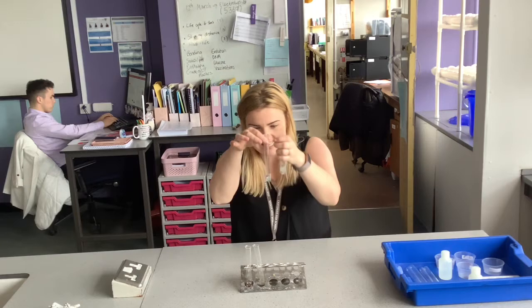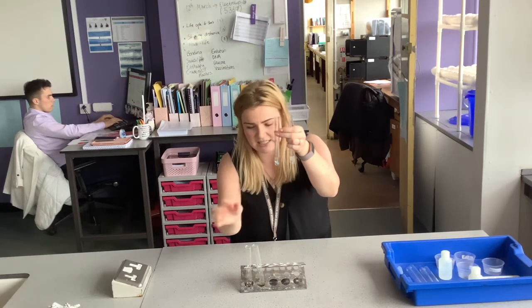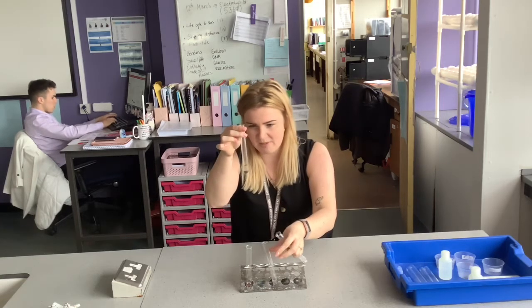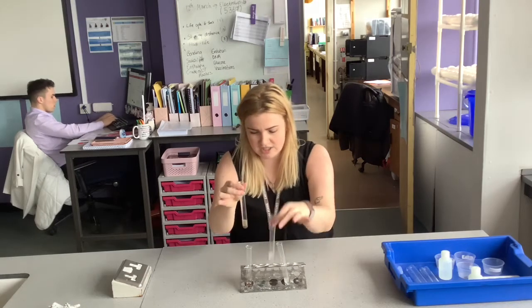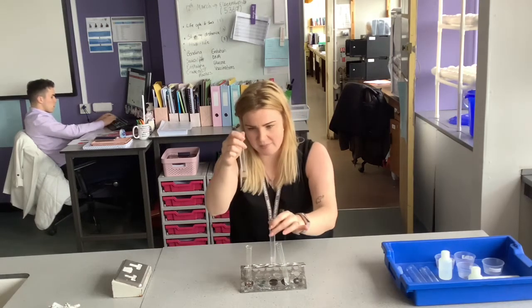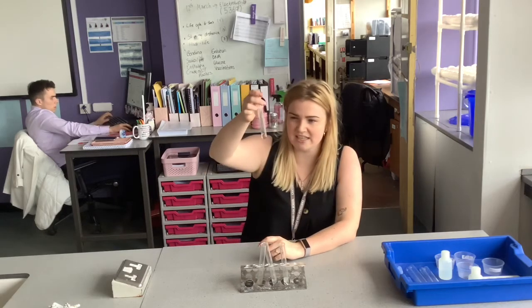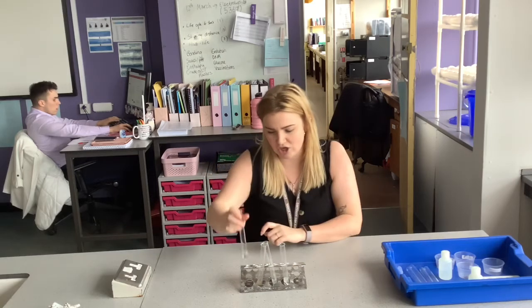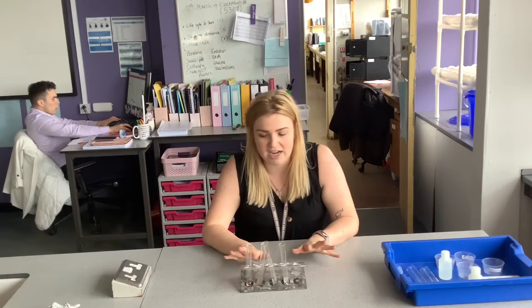Next then, zinc is the next most reactive, so it is giving off bubbles, but not as frequently as the magnesium. Iron filings then, it's gone a bit of a funny colour, but that's just to do with what is on the iron filings. There are some bubbles, but not to the extreme of the zinc and the magnesium. And then copper, after about 5 minutes, still nothing happens. So it doesn't really have a reaction with acid. We could then use this to rank metals in order of reactivity.